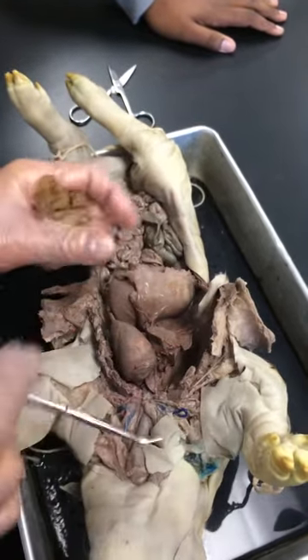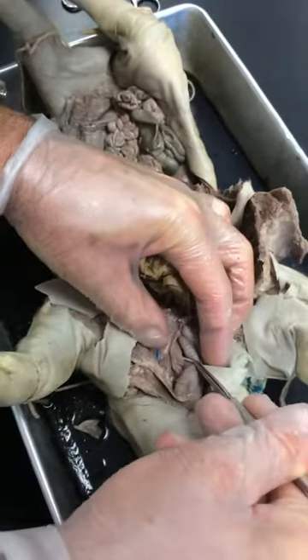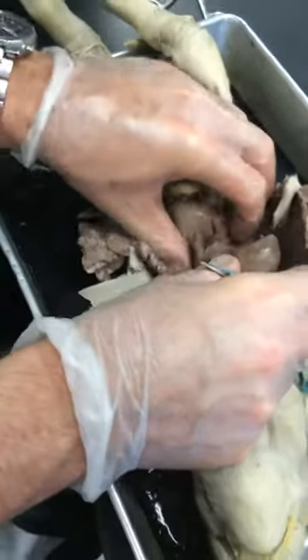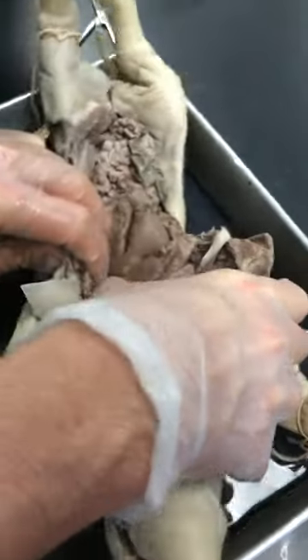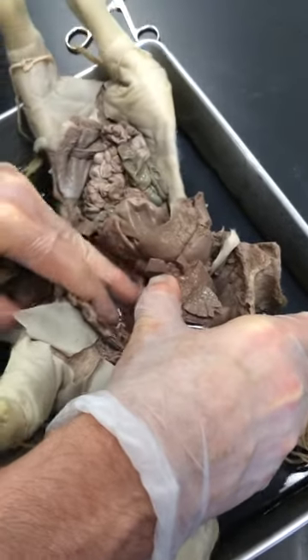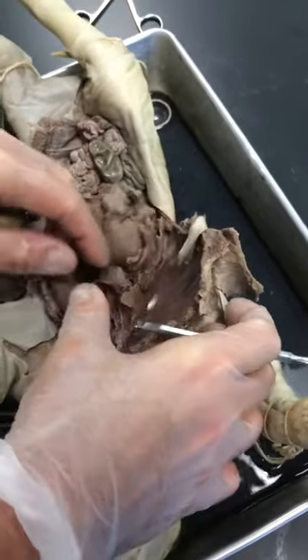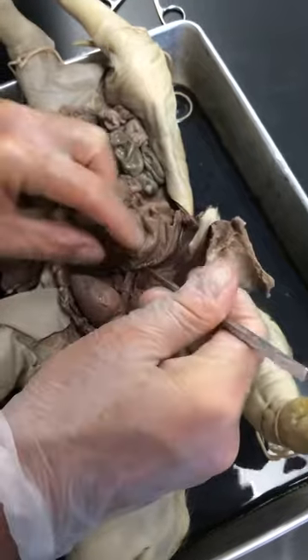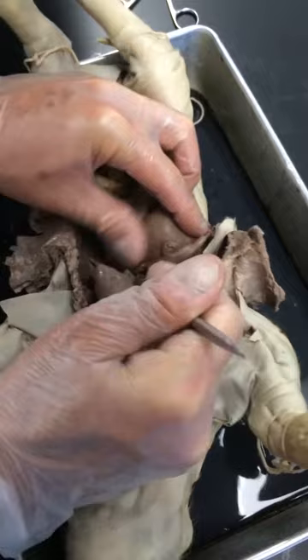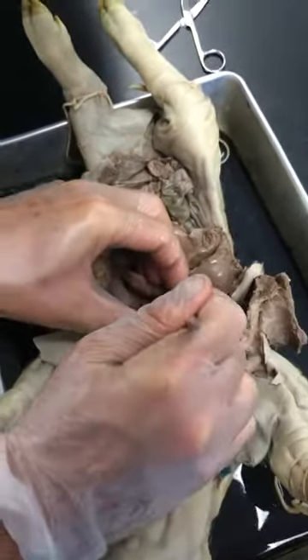Esophagus — you can see it up here in the throat. It's a collapsed muscular tube right here behind the trachea, and also down here we can see it. If you go down here, you'll see there are three tubes, two of which you've seen before. This one right here is the thoracic aorta — it's in the thoracic cavity. This one right here is your inferior vena cava, which carries blood from the posterior part of the body up to the right atrium. And then the one in between, which is less obvious, is the esophagus.